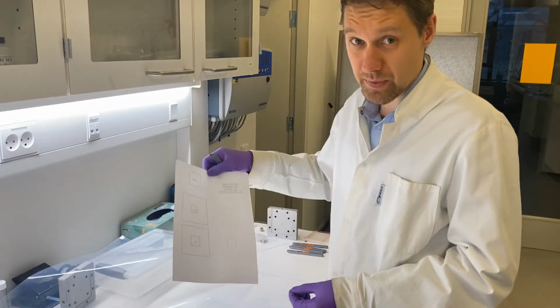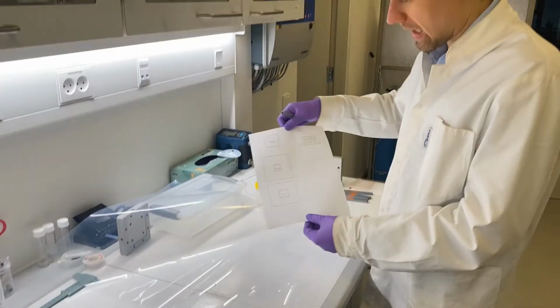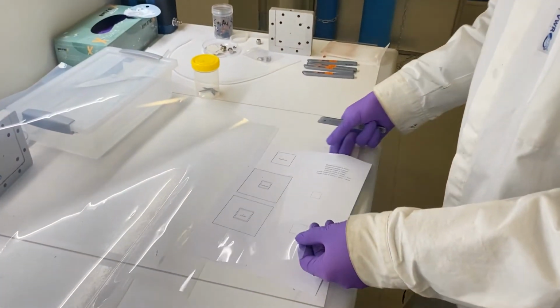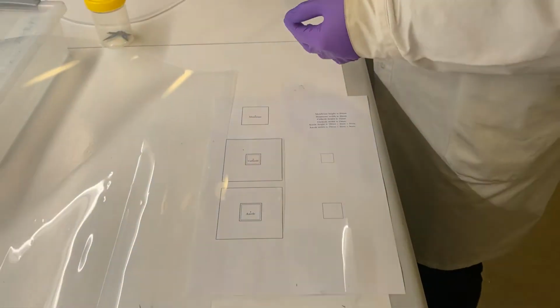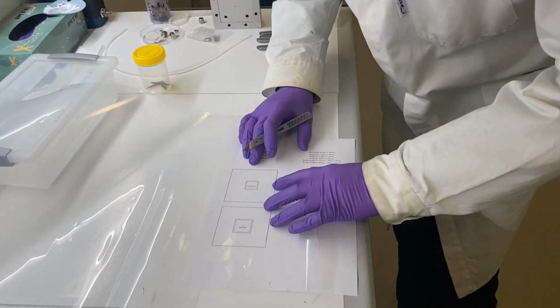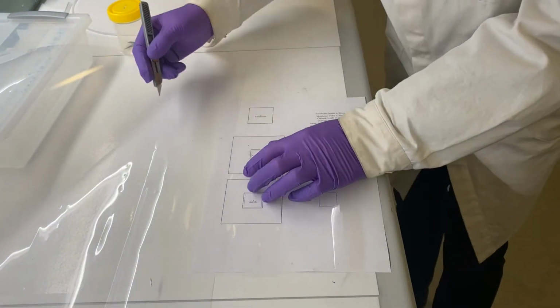So the first thing we need to do is cut out the gaskets for the assembly, and we have this template with the right sizes. So we just put this under and easily cut out large pieces. And I have separate knives for all the different pieces that I need to cut. So this one is for these Teflon sheets that we use as gaskets.